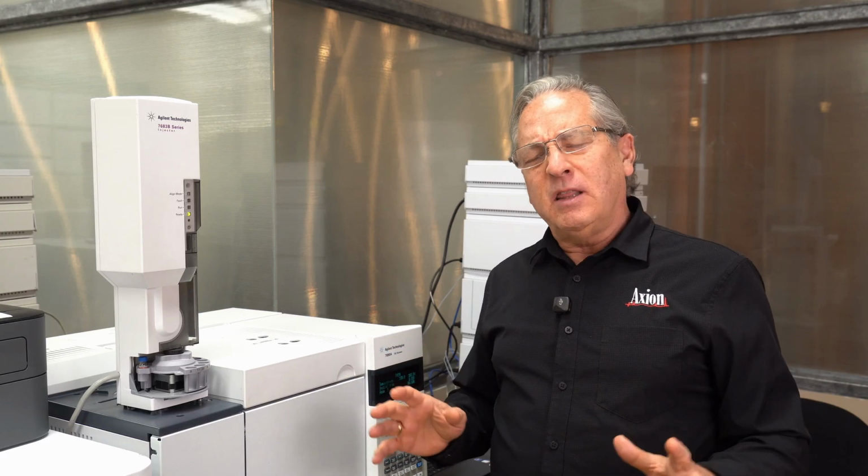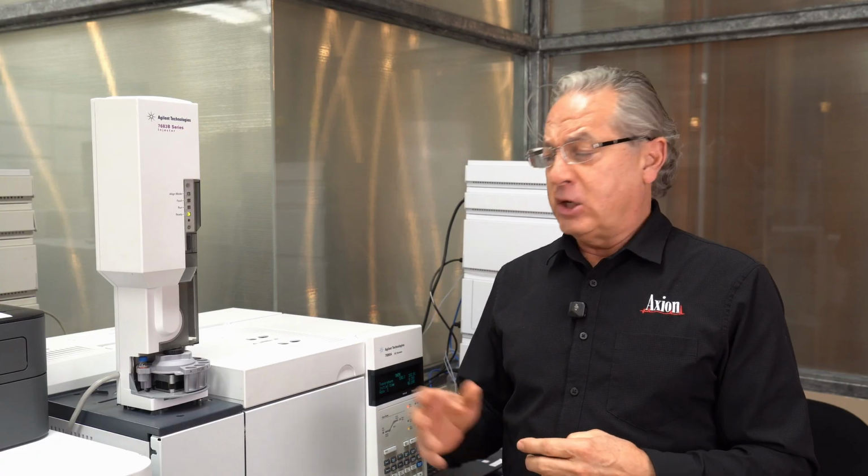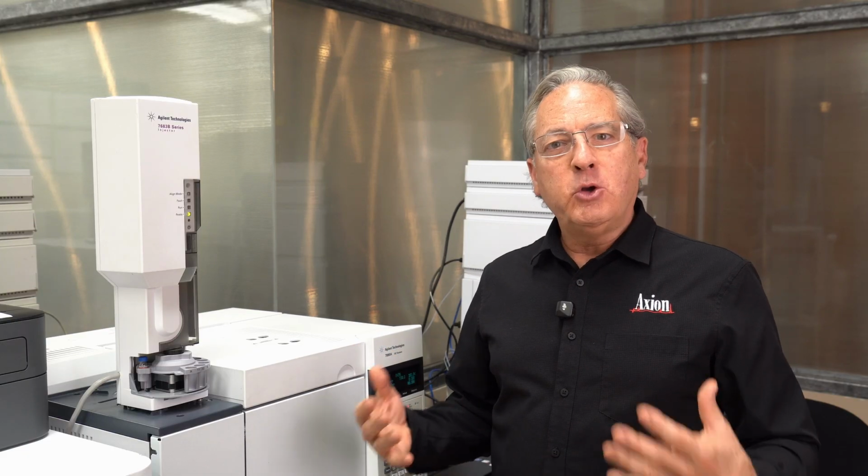Now, officially, the official way to do this is we would cool down the injection port. It's at 250 degrees right now. We'd cool down the column. We'd have the whole thing cool. We'd do all this, and we'd heat everything back up. But that's going to take me another 30 or 40 minutes. So I'm going to do it while it's hot.